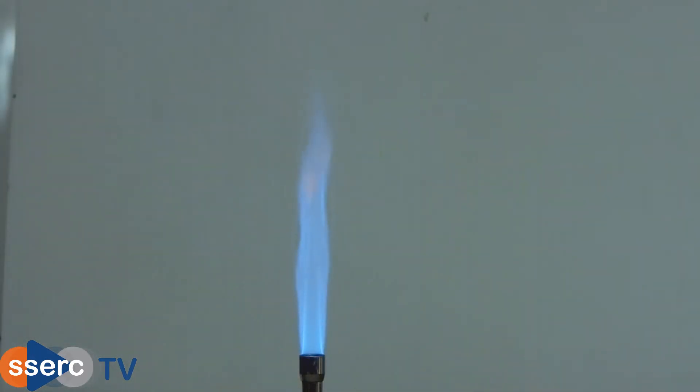The rate of a chemical reaction is always affected by the size of the particles involved. We can easily show this by trying to burn some iron.